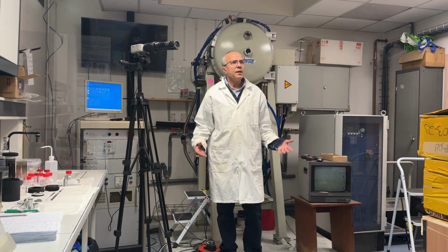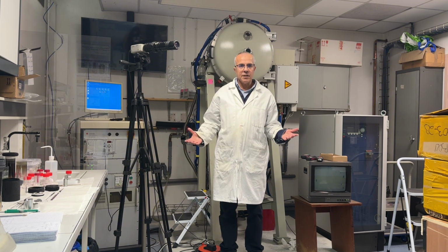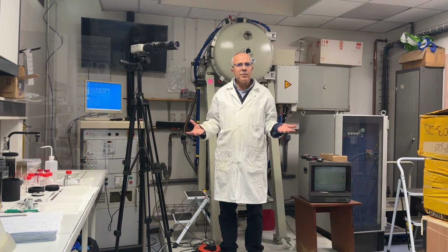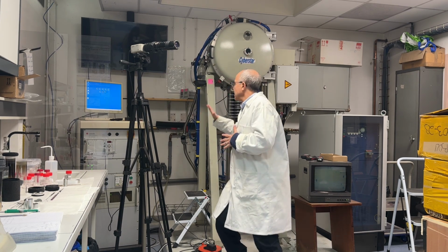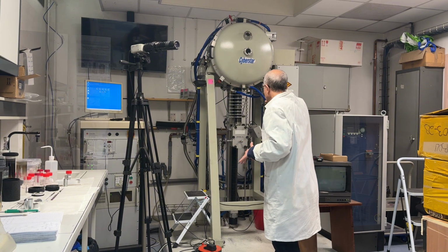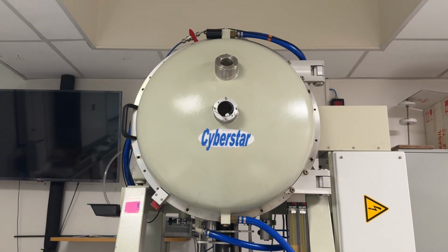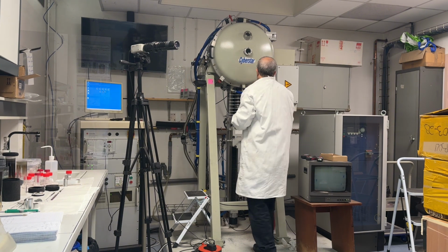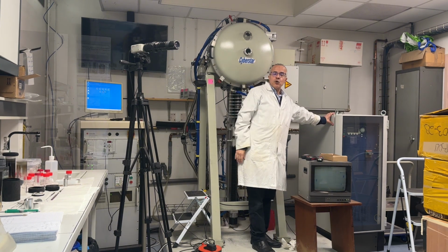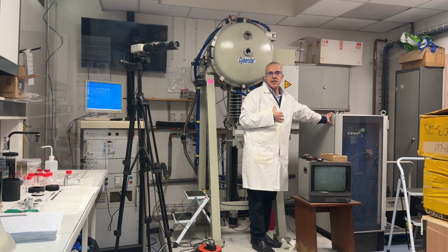Now we are in the experimental room of the micro pulling down machine. So in this room we prepare fibers or plates or tubes using the micro pulling down machine. That is our machine. The machine is composed of one chamber in which we put the crucible, the seed, and the material to start the growth, and a generator to heat the crucible. It is the same thing as what I presented to you before regarding the Czochralski crystal growth technique.